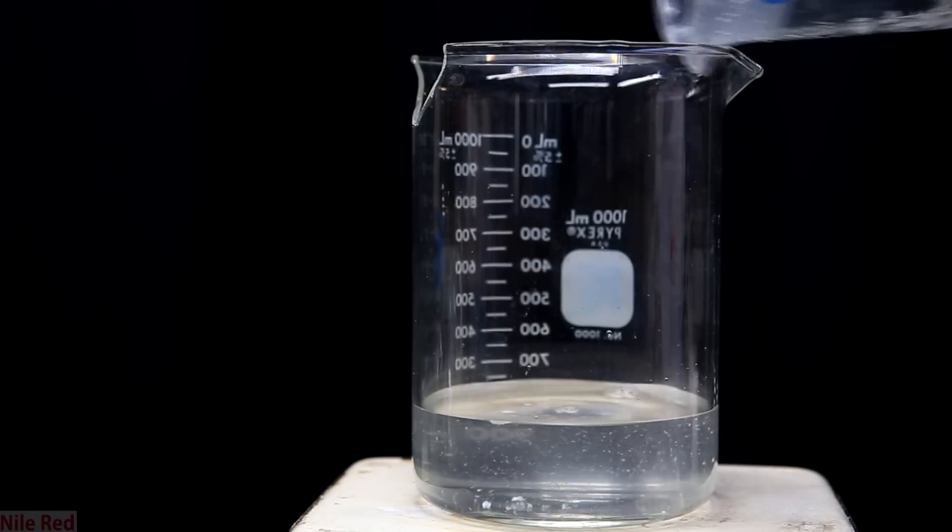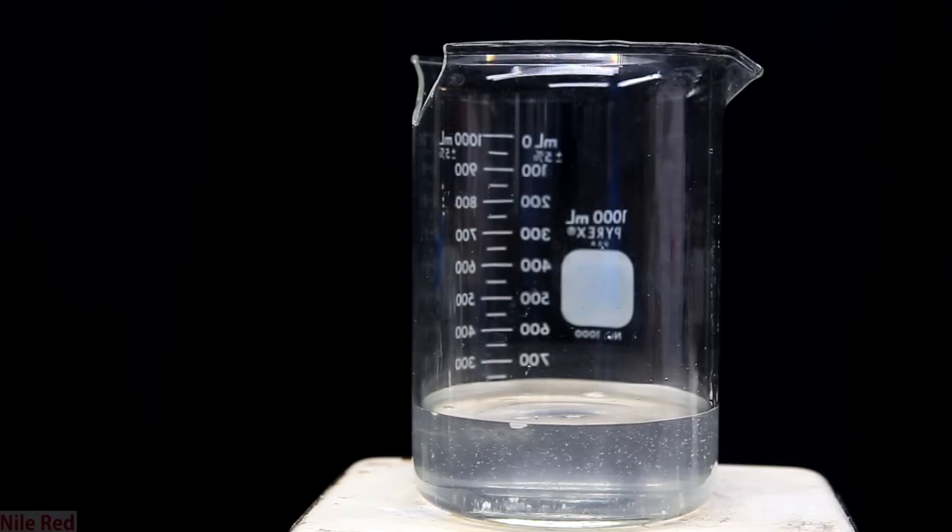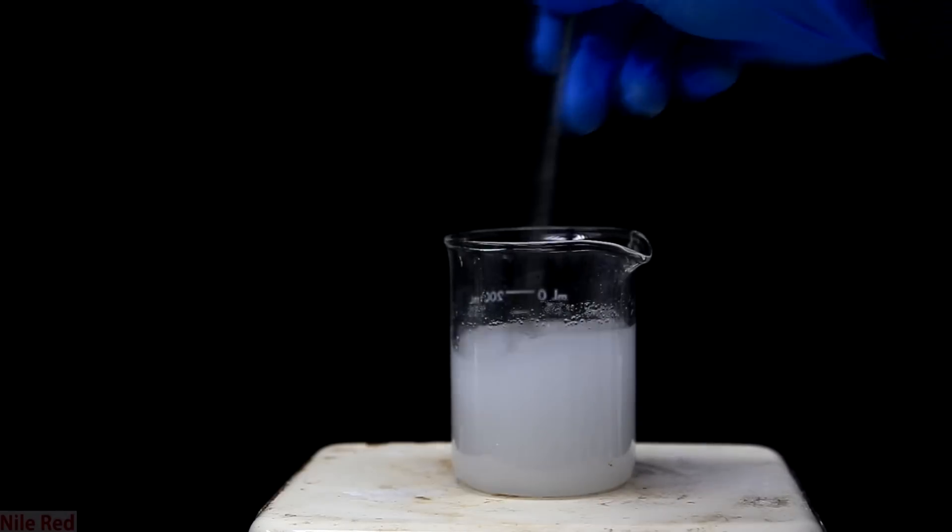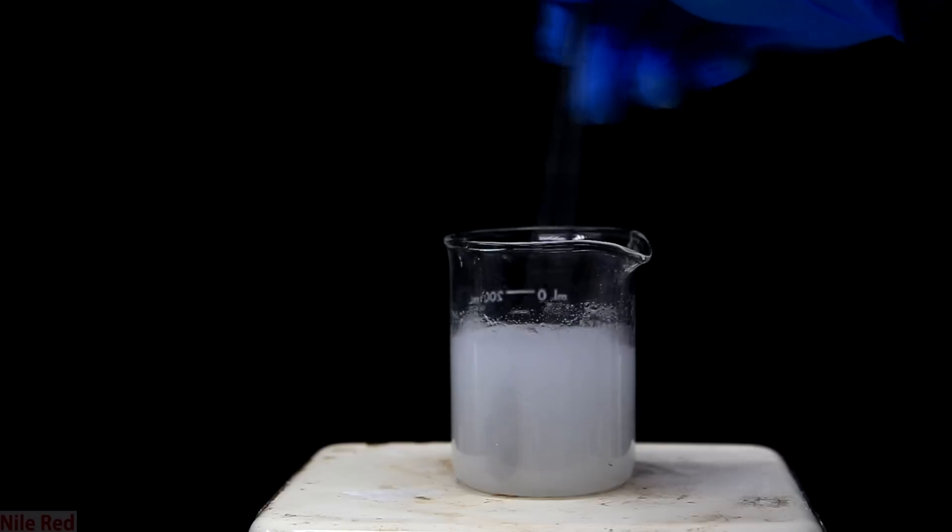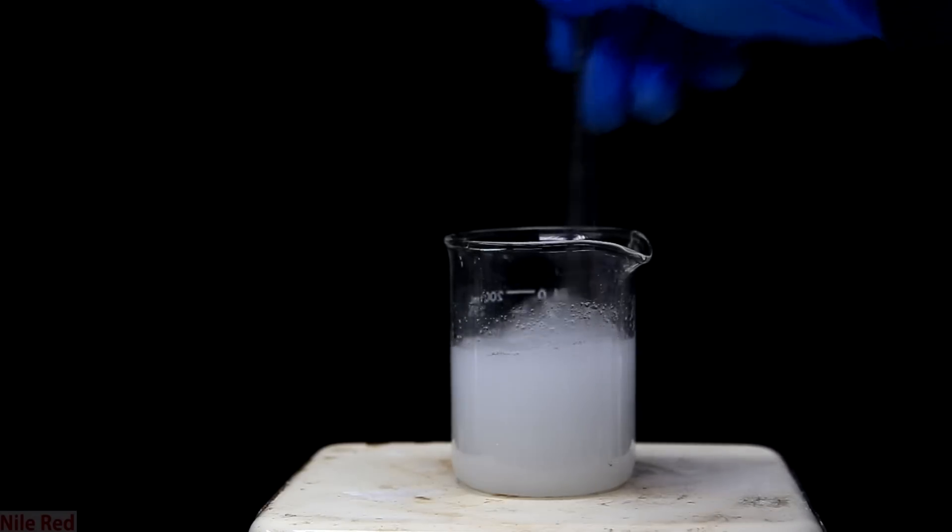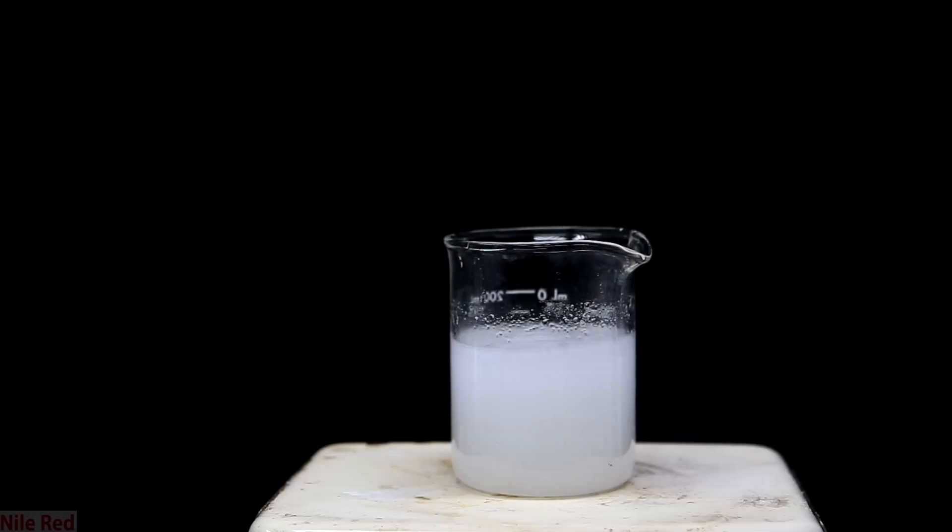I'm just going to ask you guys, please don't get mad at me, because I know there's going to be a few people out there who are mad that I wasted this lithium metal. I'm going to defend myself with two points, and that's A, it's something I've never done before, as in I've never reacted this much alkali metal with water, and I thought it could be something fun to do.